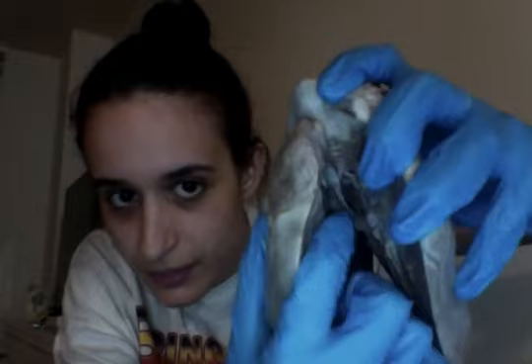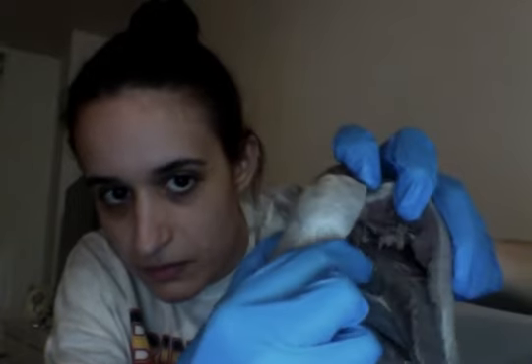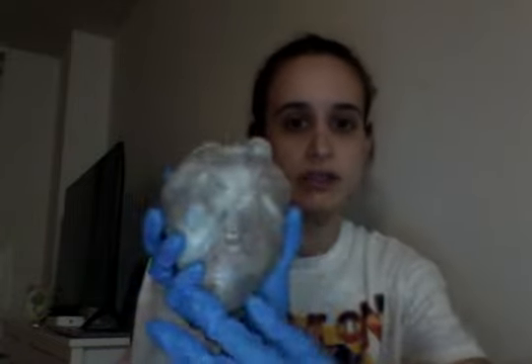From there we have myocardium, which is the tissue that forms the atria and the ventricles. So you would see that here, and then on this side, just to get another idea, all up in here. And then from there we have the epicardium, which covers the surface of the heart. So like the front of the heart is the epicardium.